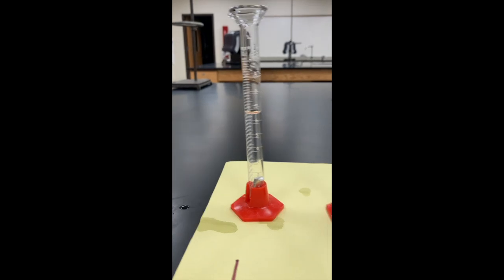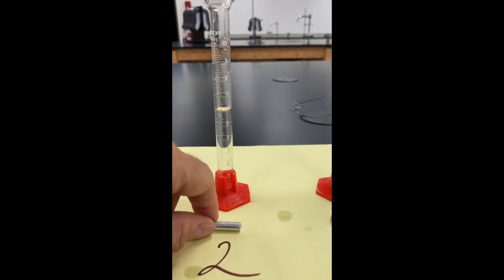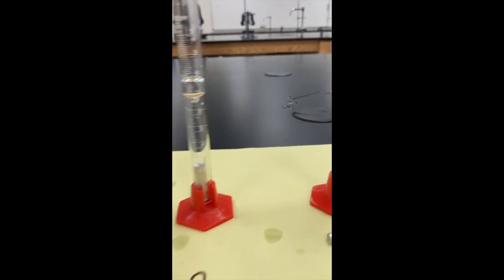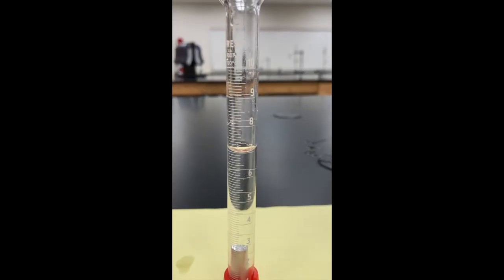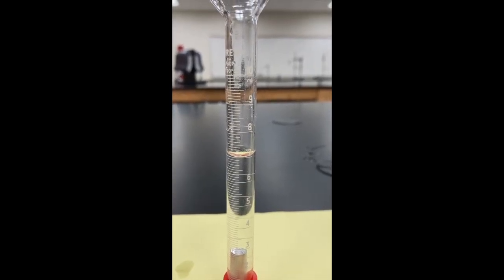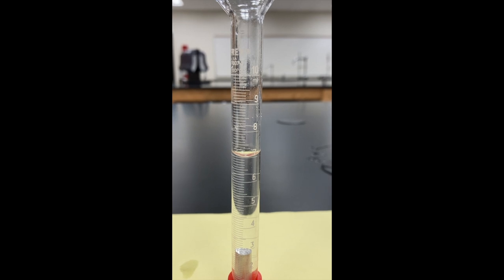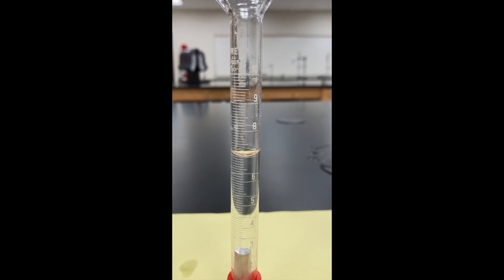Let's come over here to piece number two. Do the same thing, drop it in, we'll wait for the bubbles to finish, and then I'm going to let you read the volume of this one. So that's piece number two.